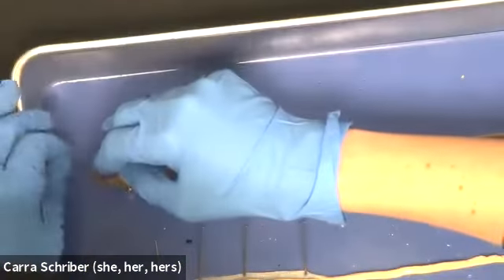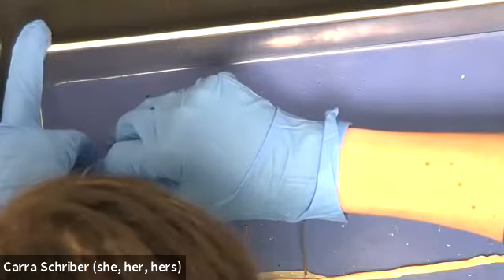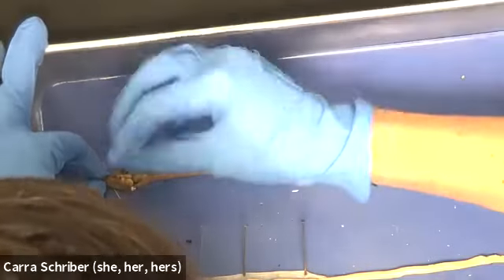And when I do that, I'm kind of cutting those connective tissues away from the organs. And it's a little tight up here, so I'm going to open up this cut a little bit more. See if we can get the head region opened up.